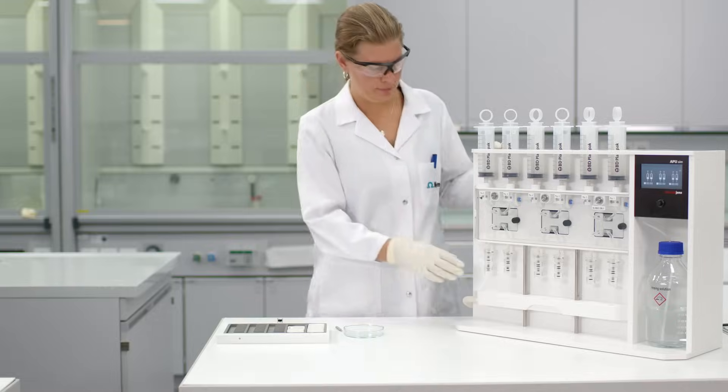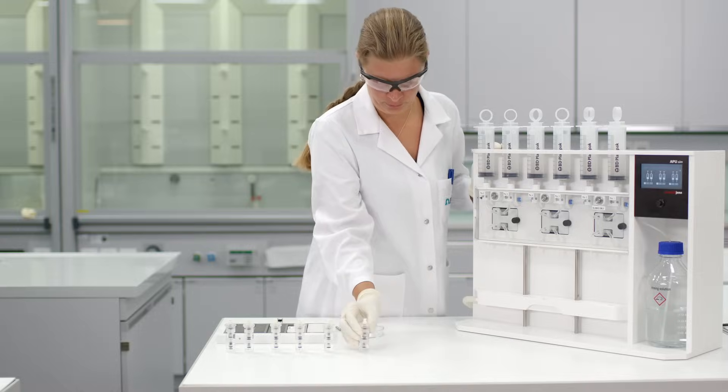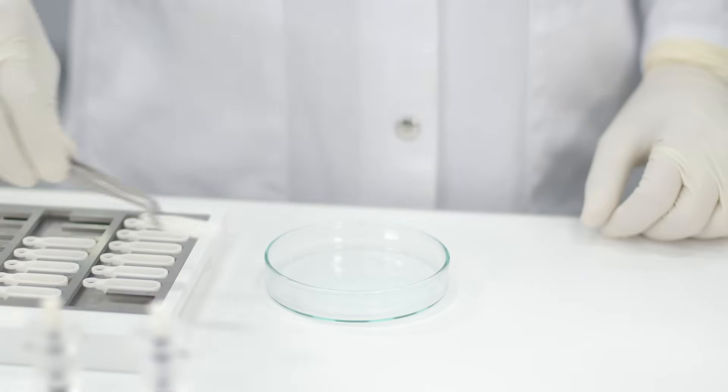The next step in this method is the combustion of the activated carbon. For this, transfer the content from the adsorption columns into ceramic boats for combustion.